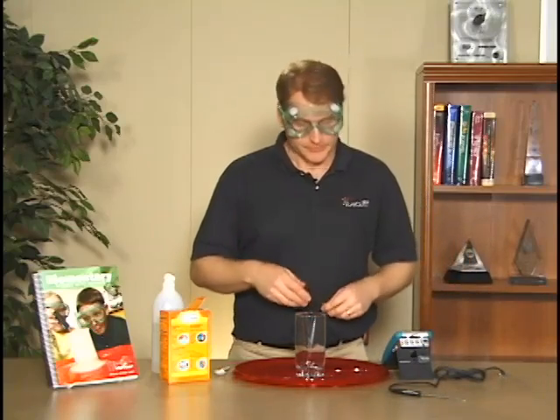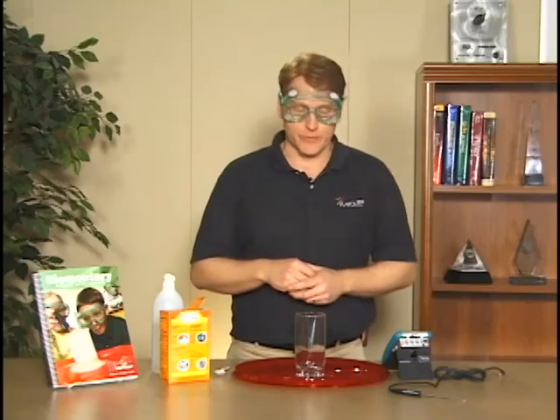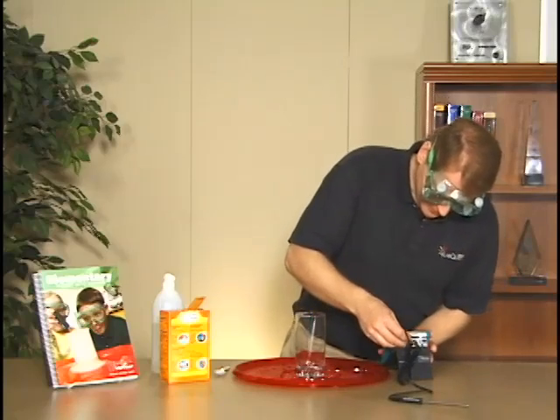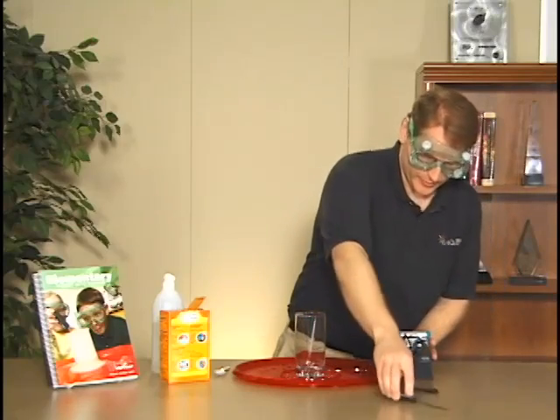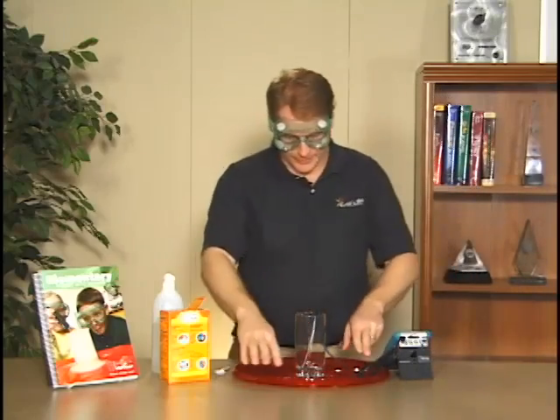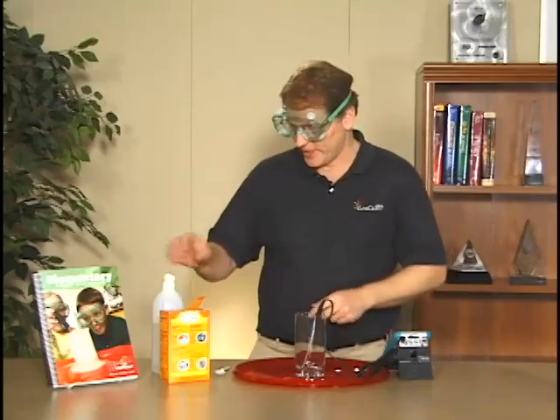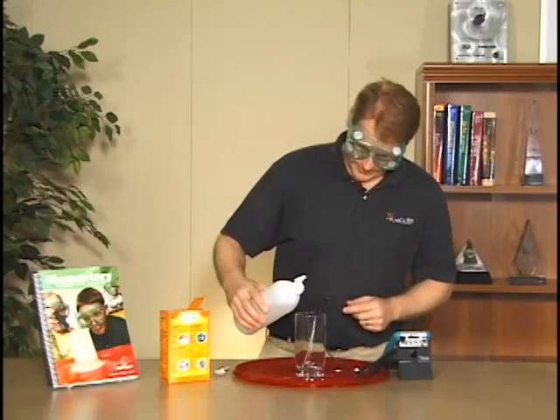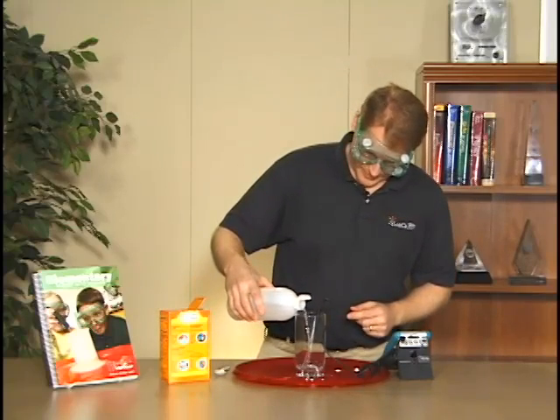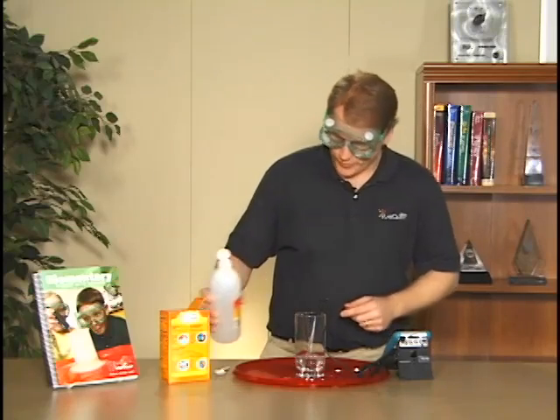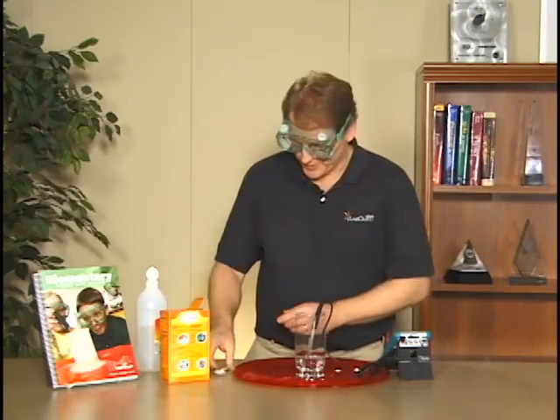To start off, I will just plug in my temperature sensor, put it down into my glass, and we have this tray here in case I get excited and make everything go all over the place with too much vinegar and baking soda. I'm going to put some in there - the book specifies how much to use, but that looks pretty good.